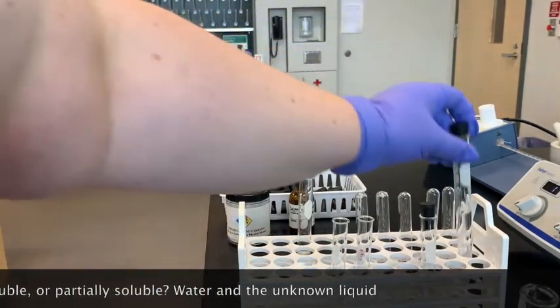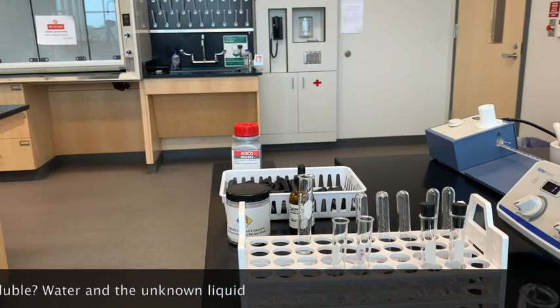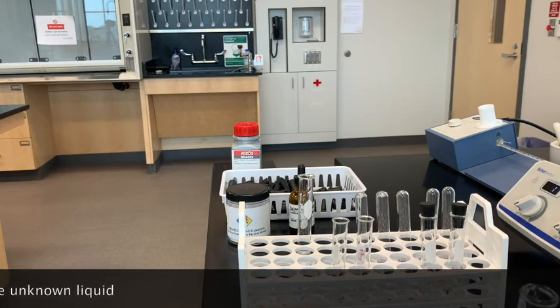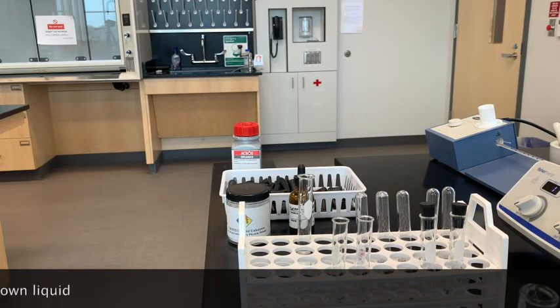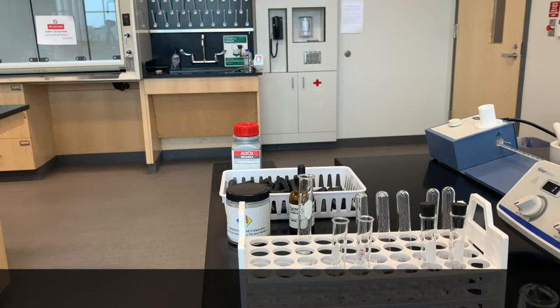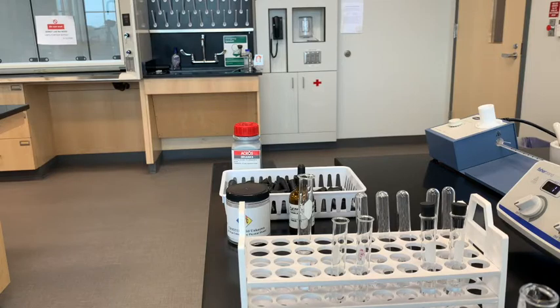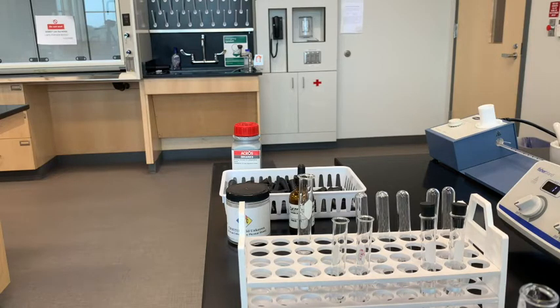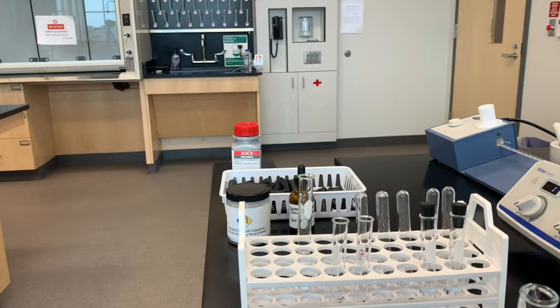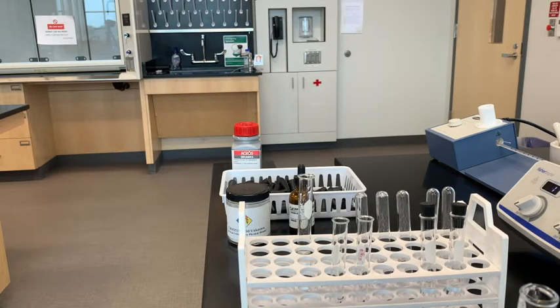The solubility of your unknown with cyclohexane and also the solubility of naphthalene will be given to you — you can check the PowerPoint for this lab. We're not going to do those in lab because they're kind of smelly and I don't want to stink up the lab.